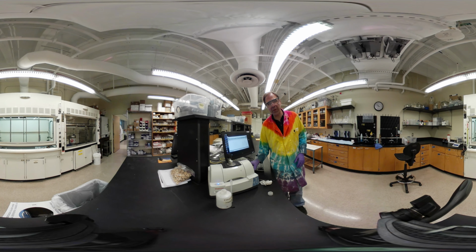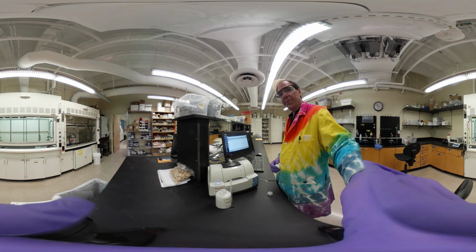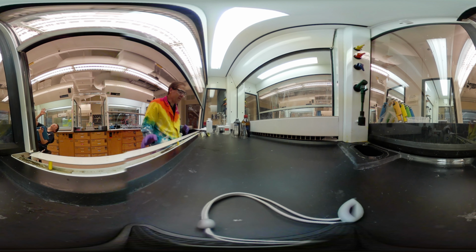Now it's time to do our other characterization test, which is a chemical reactivity test. So we're going to head back to the hood to do that. Okay, we are back. It's time to set up for our second characterization test, which is the chemical reactivity test. And I need to create 2 different stock solutions here.